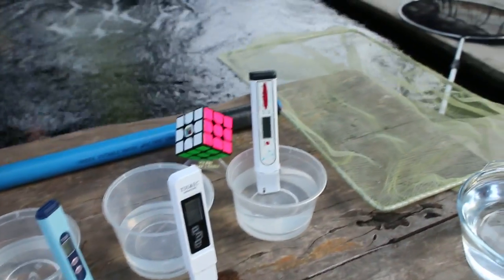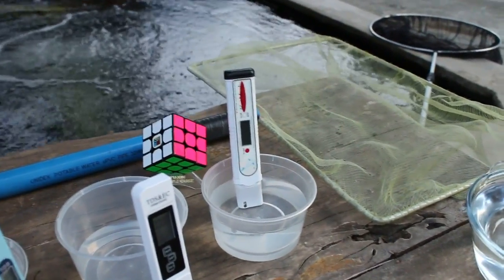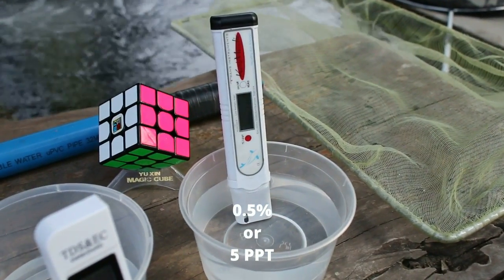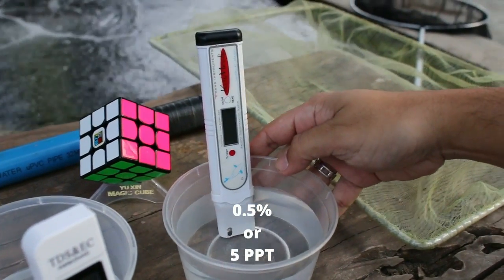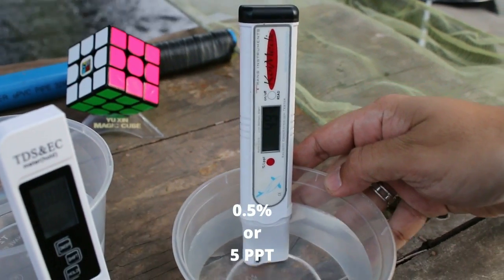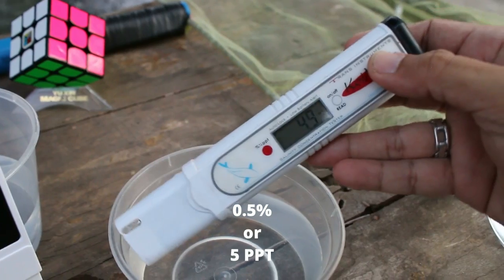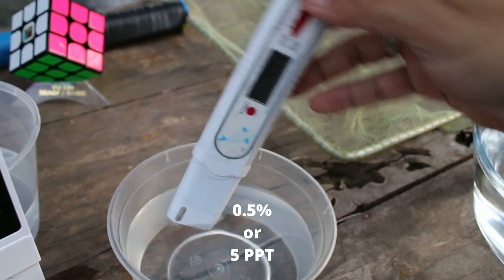So it's reading at 4.9, which is close to 5.0 parts per thousand. I hope you can see it. I'm going to bring it closer so that you can all see it. Okay, right there. 4.9.